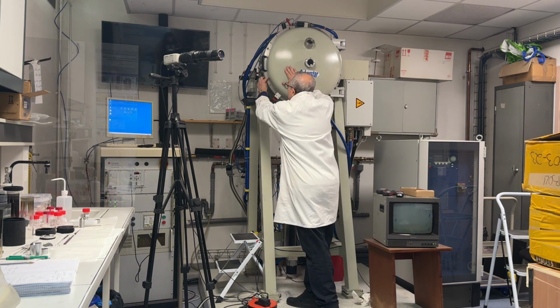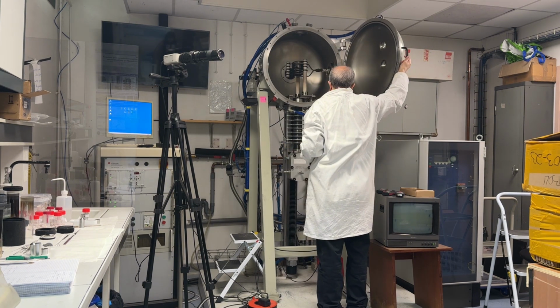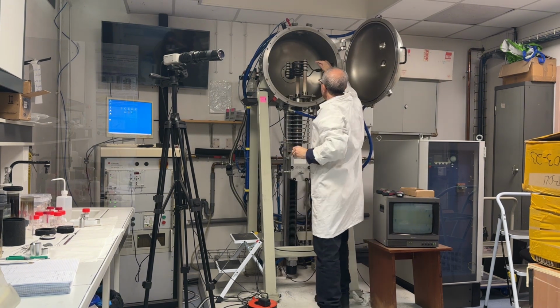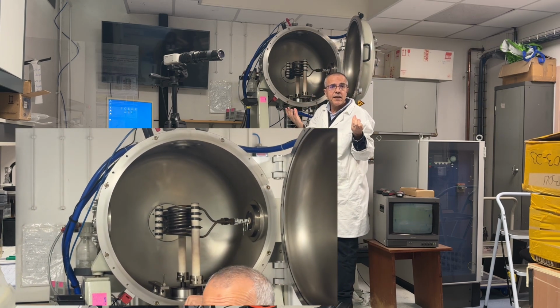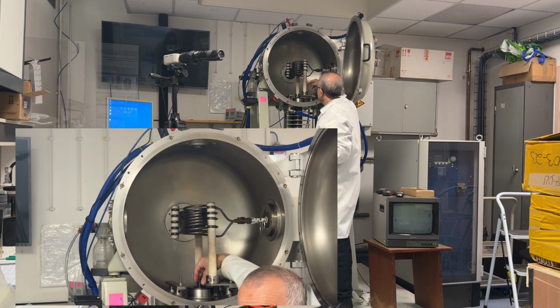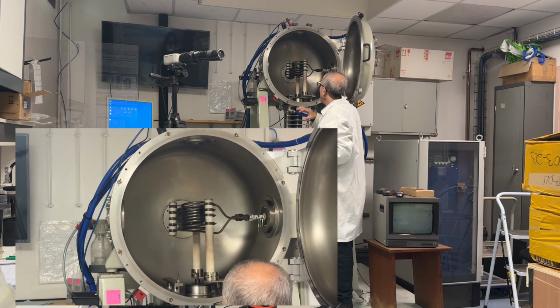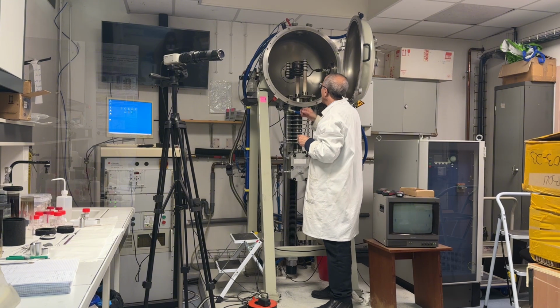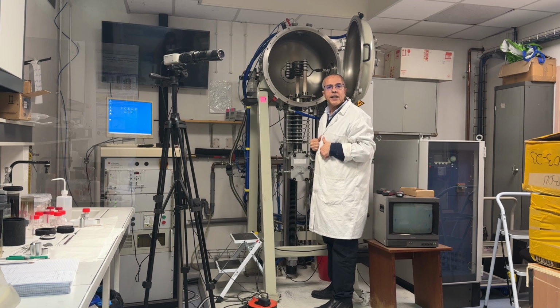Now I will show you the inside of the machine. The machine is composed of an RF spire, and here that is the inside of the chamber. As you see here, you have the RF spire in which we create a magnetic field which heats the crucible. And here we have a seed holder in which we put the seed, and I will now explain to you the different steps to grow a fiber by the micro pulling down technique.